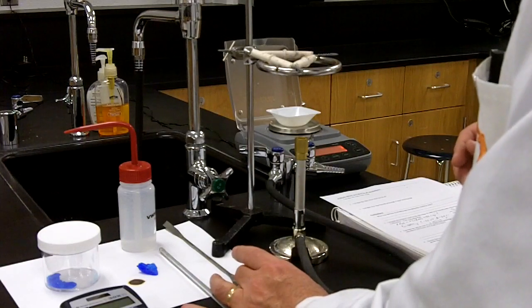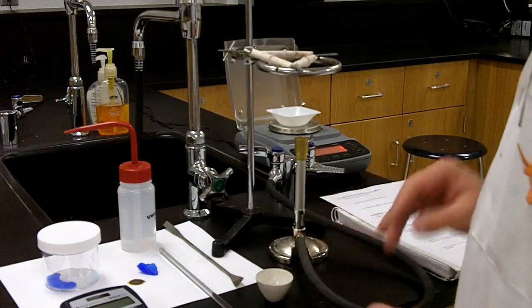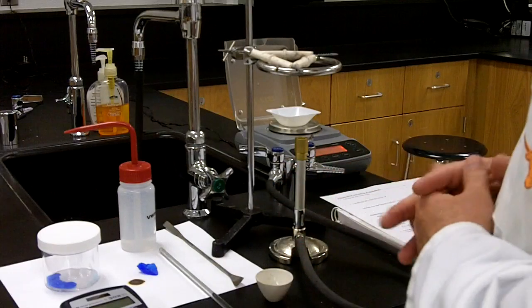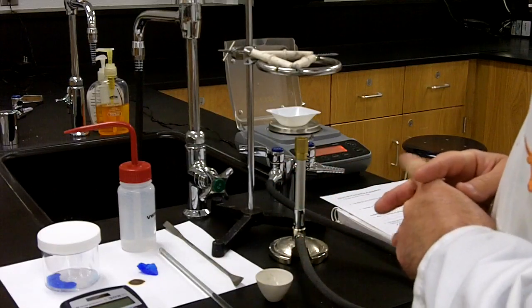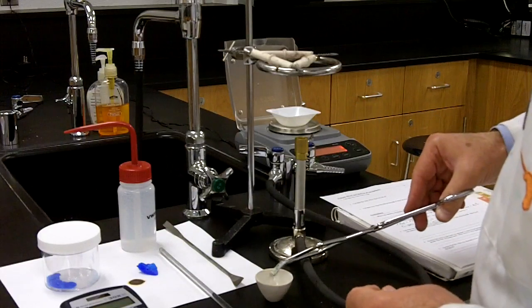I can see that this crucible is pretty hot, and I'm just not sure that I would want that on the balance. So I'm going to wait just a few minutes before I put it onto the balance. I'll move it over here, just so it's a little bit closer to the balance when I get ready to move it.